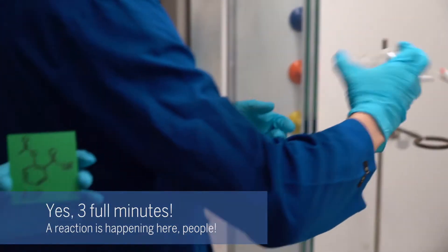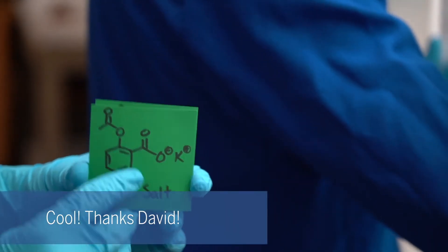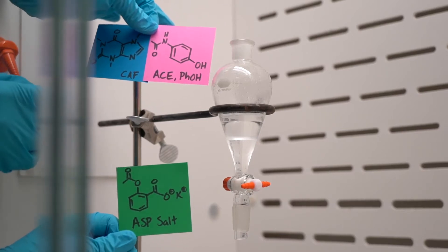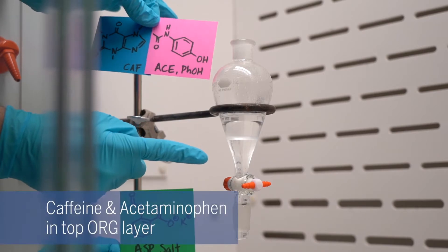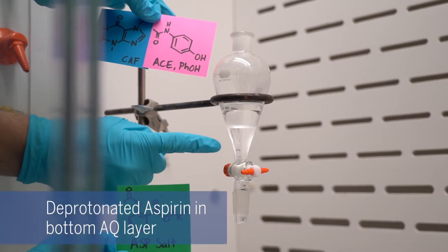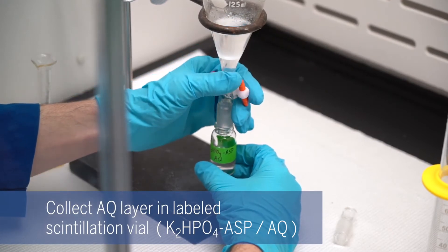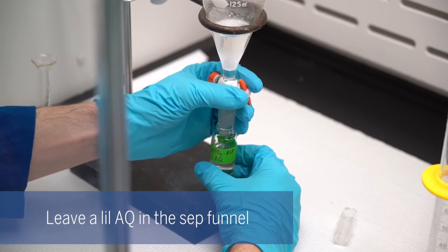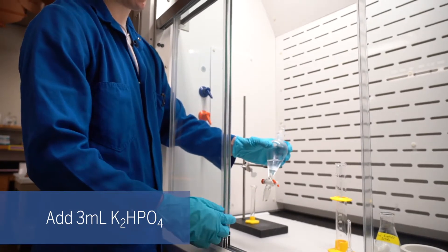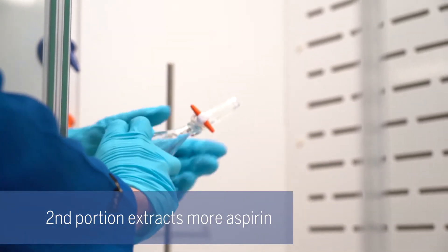What we're doing now is taking the aspirin from the original mixture of Excedrin and by adding the potassium phosphate, we're creating a salt. After you add the potassium phosphate, you're going to get two layers in your separatory funnel. On the top you're going to have ethyl acetate which contains caffeine and acetaminophen. On the bottom you're going to have the aqueous layer which contains the deprotonated aspirin. We've added a second smaller portion of potassium phosphate — typically when you do extractions you will do multiple washings to improve your yield.